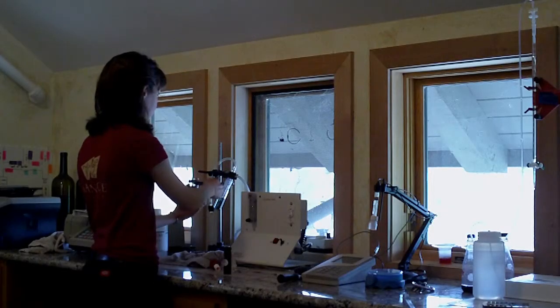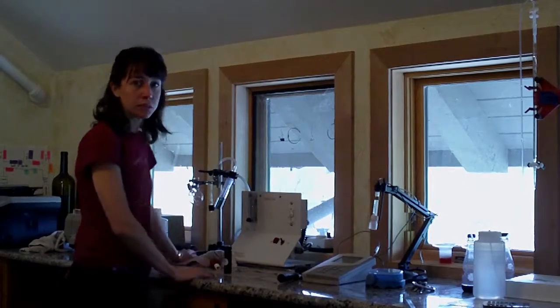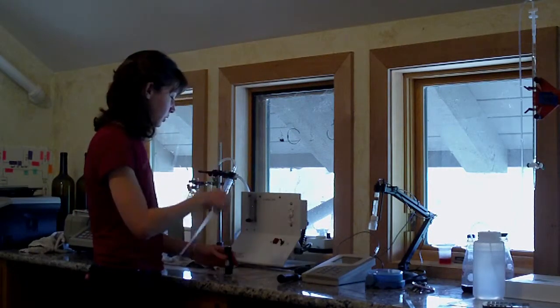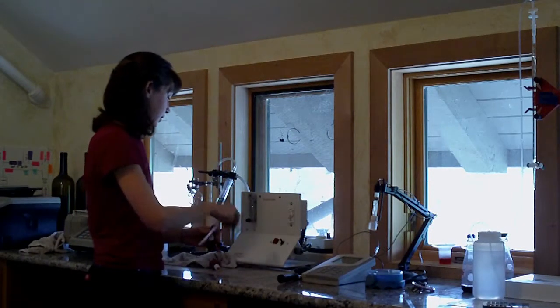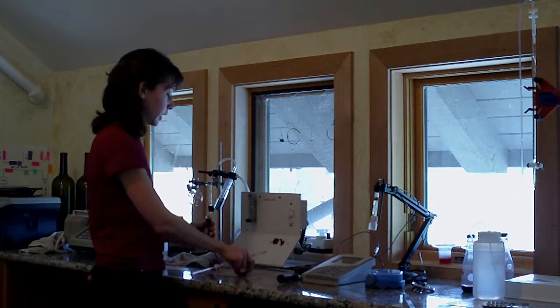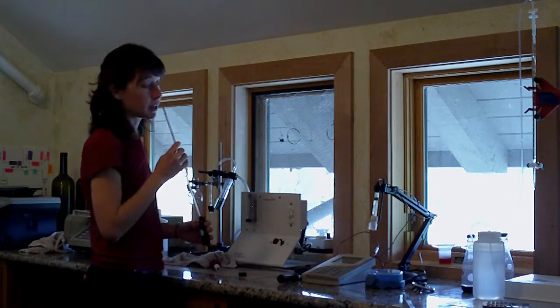So this is the free sulfur machine and I'm actually going to run a test right now on a red wine. This just gives me a very good indication of how much free sulfur is in the wine, and if there's not enough then we need to add more.